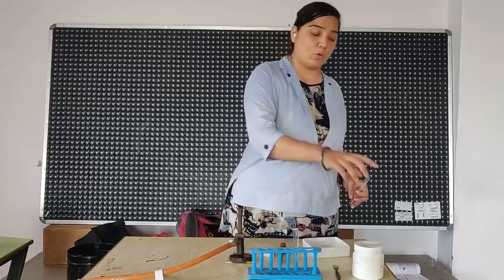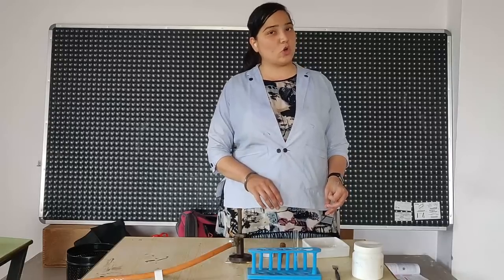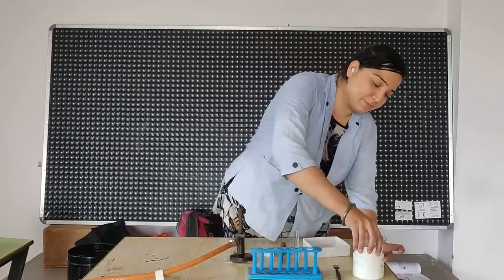In one test tube, we will take some amount of lead nitrate. So, let's put it.